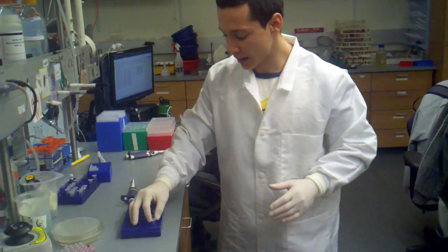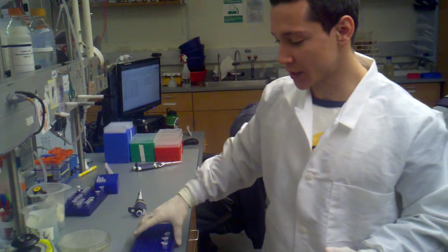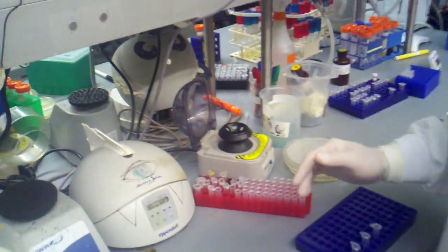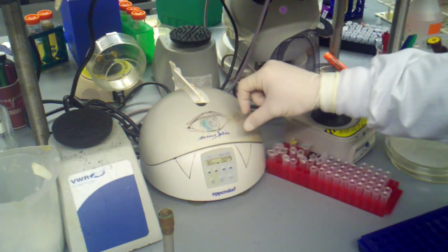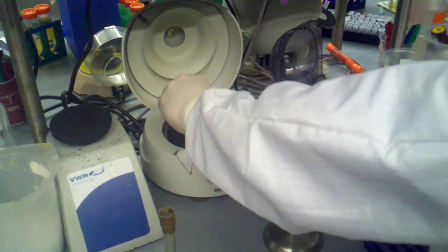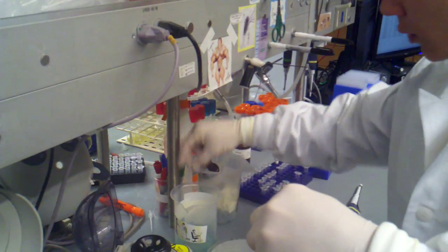So put it here. And now, after this step, we're going to be emptying the flow-through columns, and then we're going to be doing our drying step. So our centrifuge is slowing down right now. And again, as kind of a side note, you always want to be sure to cap your centrifuge with that little metal thing that I put on there, as well as make sure that it's balanced. So now we can take a look at our flow-through columns. You can see there's our wash buffer.